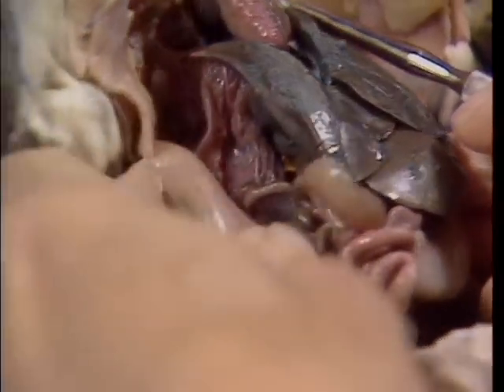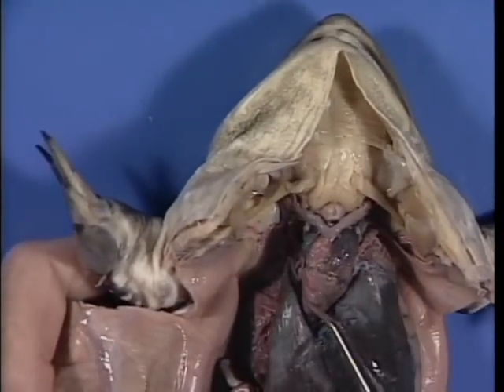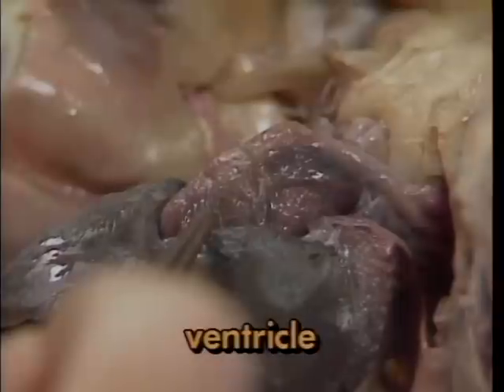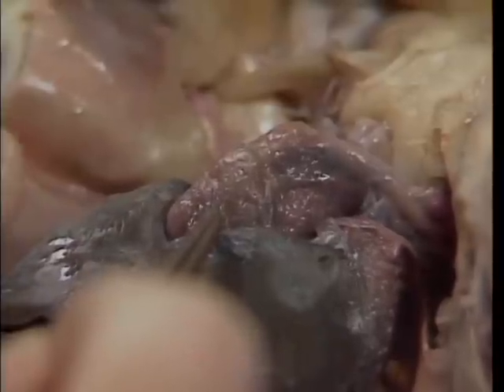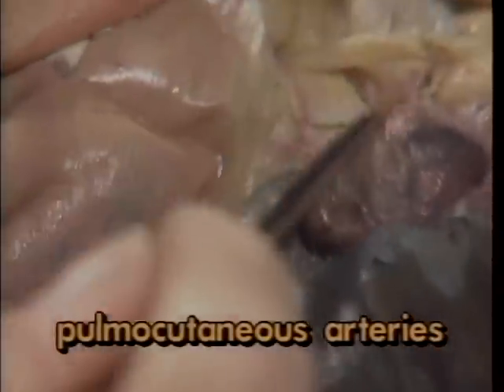Contraction of the right atrium carries blood into the heavy walled chamber of the heart, here, known as the ventricle. Contraction of the ventricle carries blood low in oxygen out of the heart through the pulmocutaneous arteries.